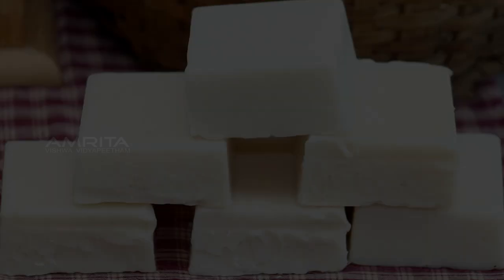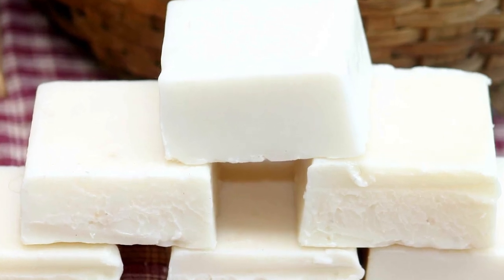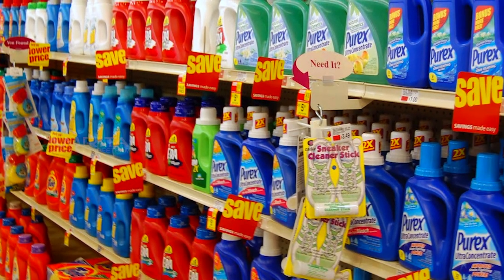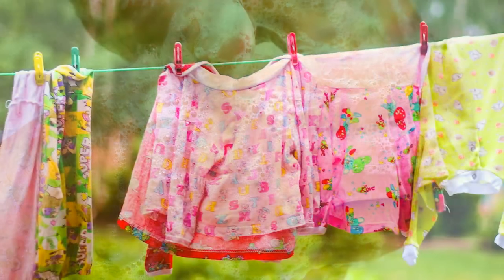Cleaning Capacity of Soap. Soaps and detergents are commonly used cleansing agents in our daily life. They remove dirt and grease from the skin and the clothes.